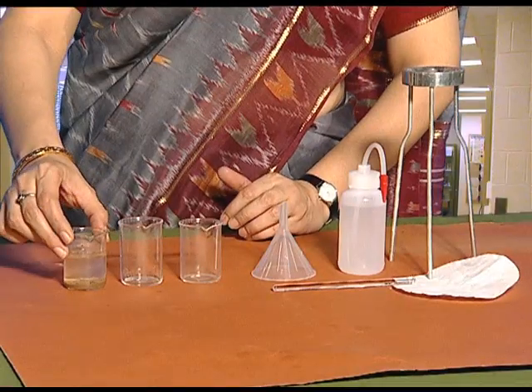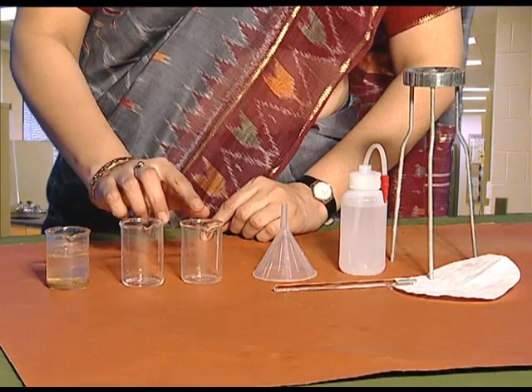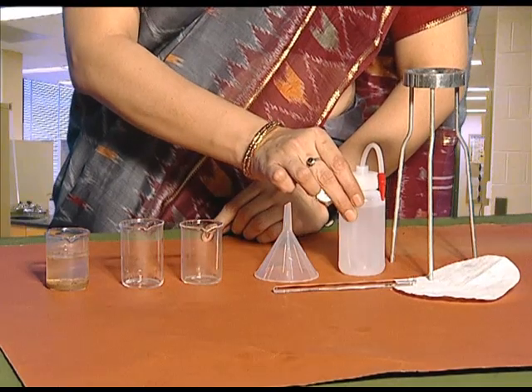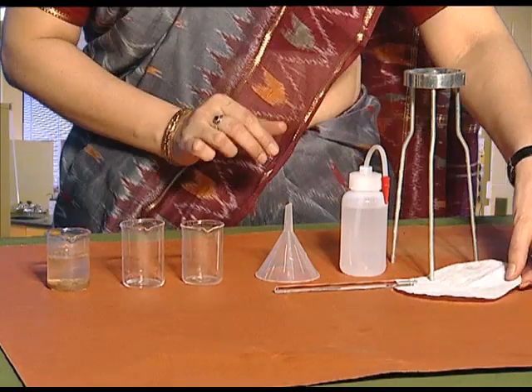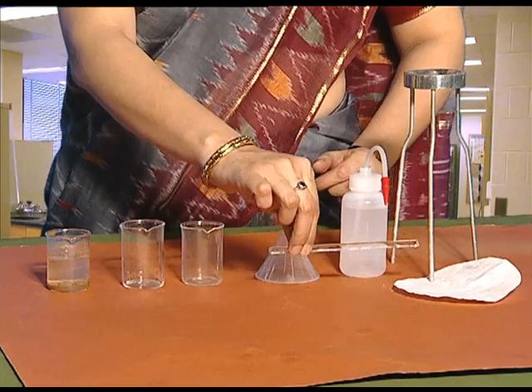We will do the activity of separation of mud from muddy water. For this we require a beaker containing muddy water, two empty beakers, a funnel, a wash bottle, a tripod stand, filter paper, and a glass rod.